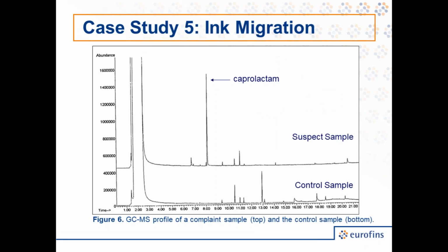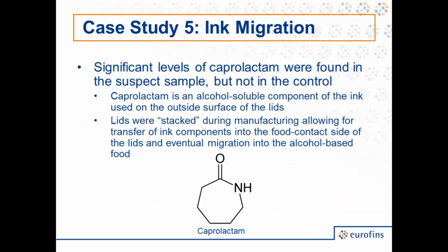As you can see on this slide, when we compare the control and the suspect sample, there's a rather large and distinct peak in the suspect sample that's not in the control. And this was identified as caprolactam. Caprolactam is an alcohol-soluble component of the ink that was being used on the outside surface of the lids. And so what was happening is, as these containers were being filled, a bit of the alcohol-based product was splashing onto the lids, causing the ink to run.